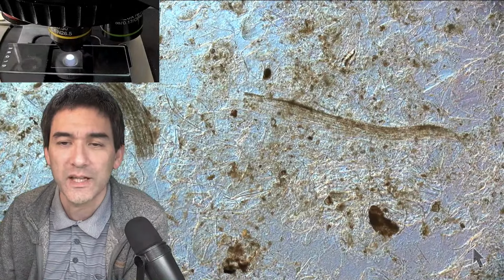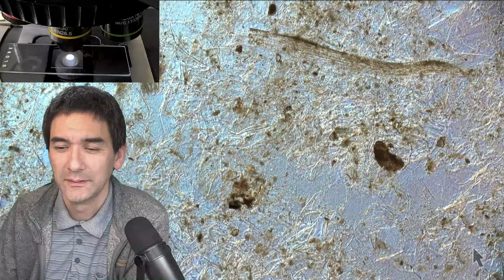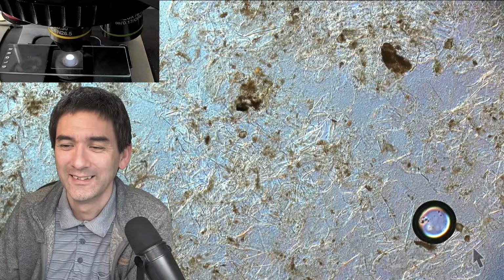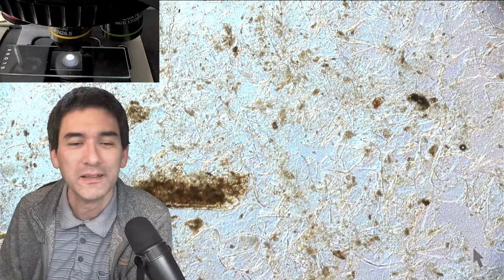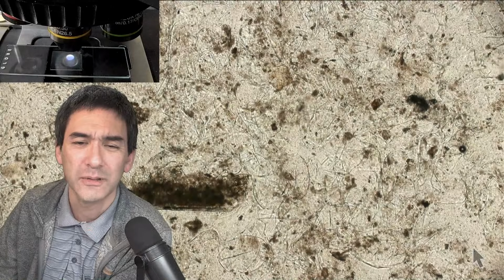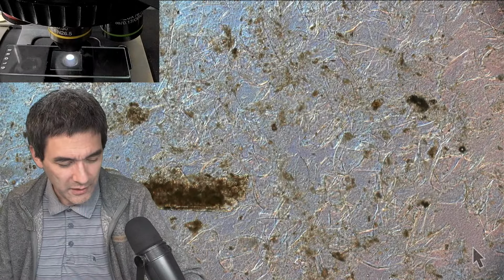Xylem are the vessels that transport water. Yeah, xylem from the banana. I'm kind of worried that this has been mixed too much, but this was the idea: am I able to find it? I don't know. The contrast is really poor. Let's try the bright field. Bright field is not much better. So by the way, what's in here?